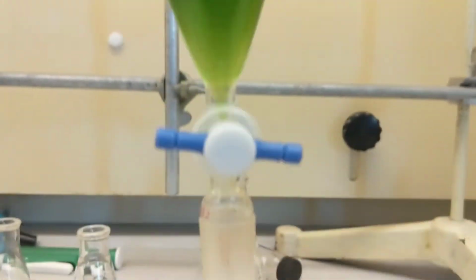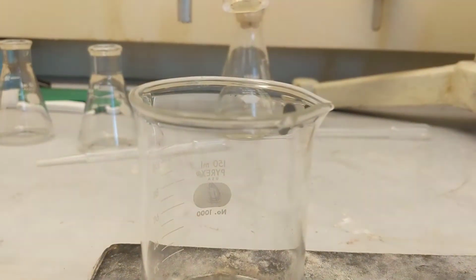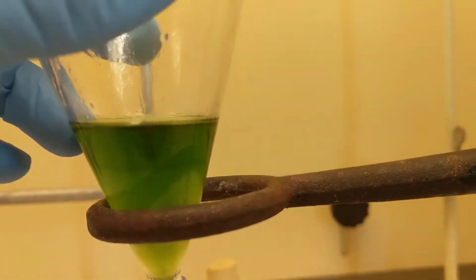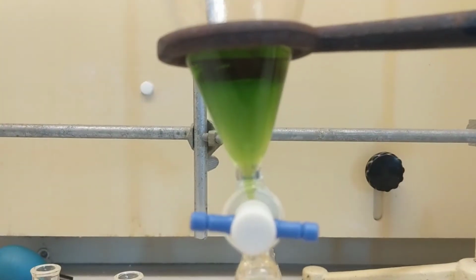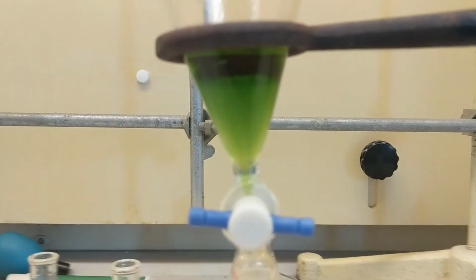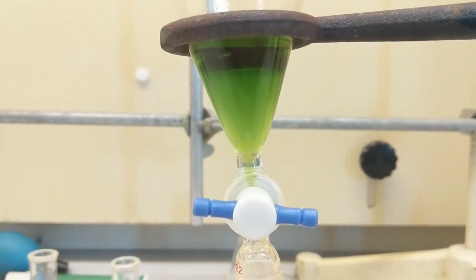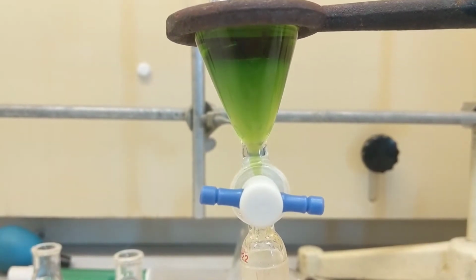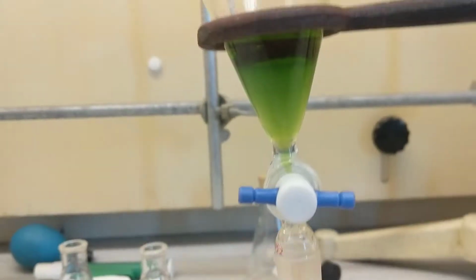So what we're about to do is pull this bottom aqueous layer down into our funnel. I mean, just into here. It doesn't really matter where, we're gonna get rid of it, and keep our top hexane layer. And then we're gonna evaporate the hexane off, right? Just so we can see our pigments, make sure that we have some serious extracts in there. Whoa, focus. Thank you. And then we're gonna redissolve it in 0.5 milliliters of hexane, just to make sure we have it really nice and concentrated. And that's that. So I'll see you guys after I pull it out.